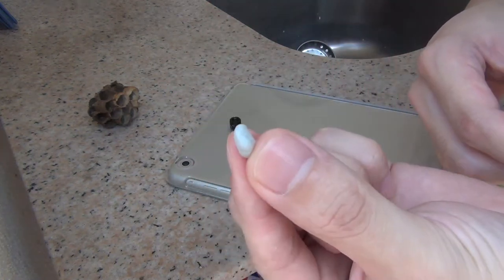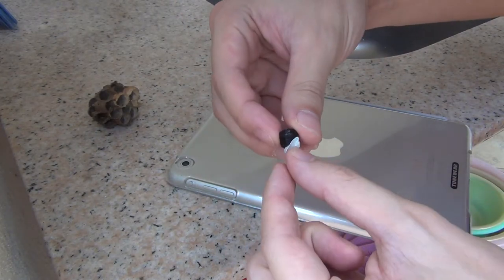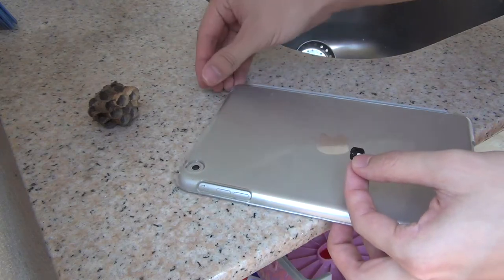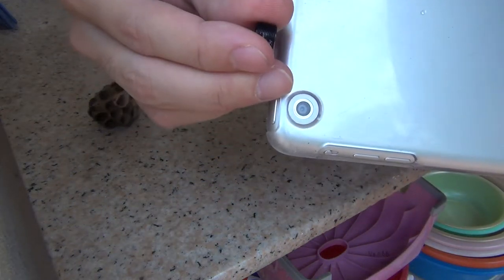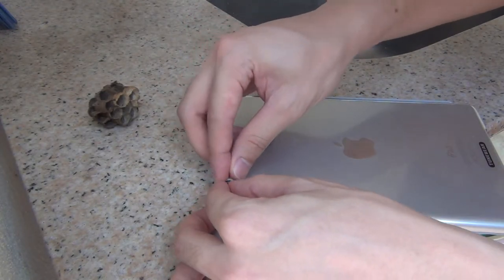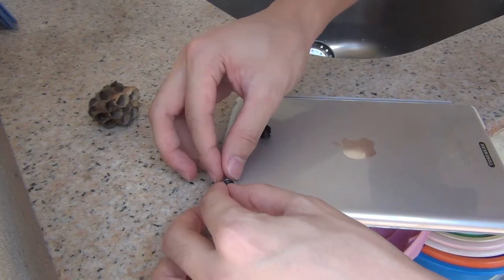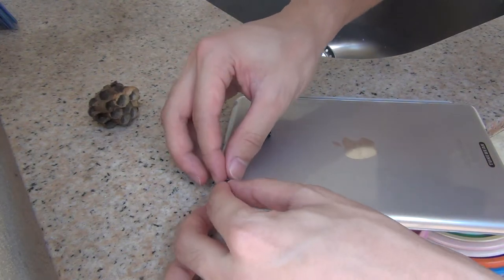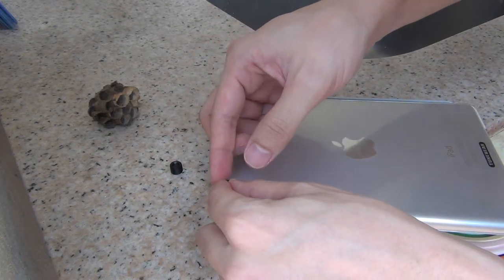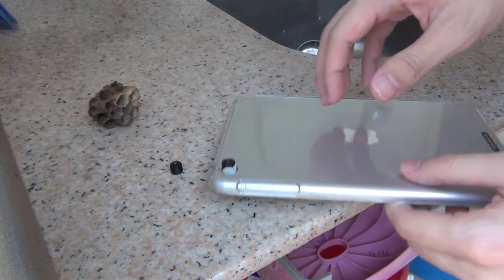Here's a piece of Blu-Tac and you just wrap it around. Here's the iPad with the camera — just stick it above the camera. You want to make sure that the lens is smack in the middle, because with the lens in place, the field of view of the camera will be narrower than normal, and so you get a black circle.